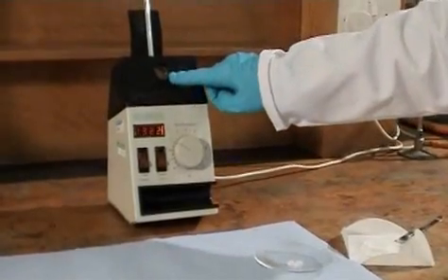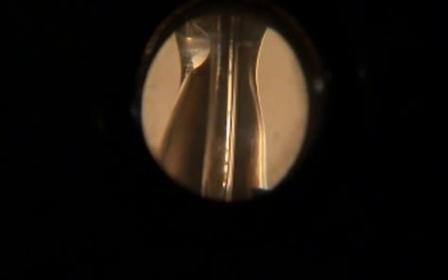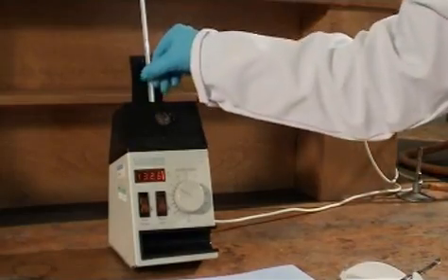Watch the solid until you just see it starting to shrink from the side of the tube and that's the first sign it's starting to melt. You need to take a range of the melting point, so record the temperature at which it starts and finishes melting.